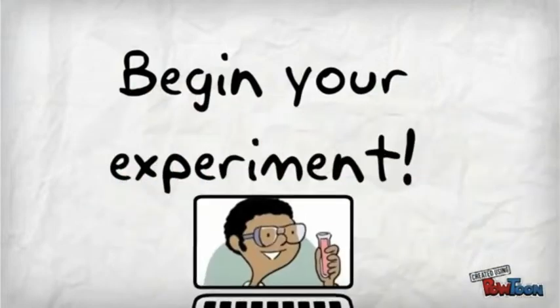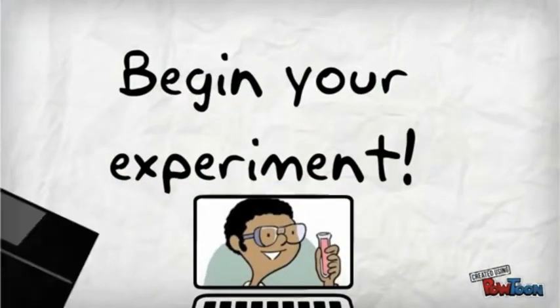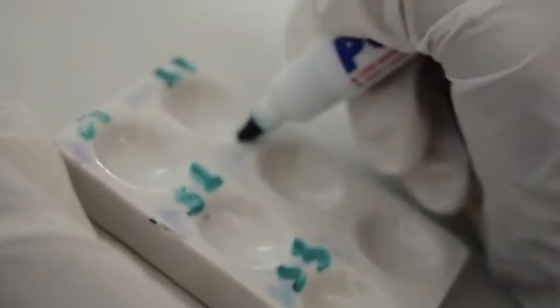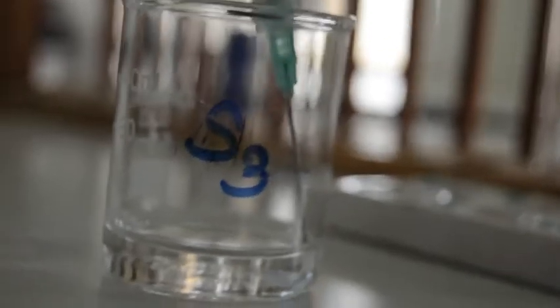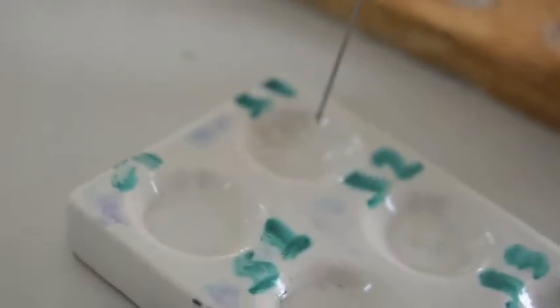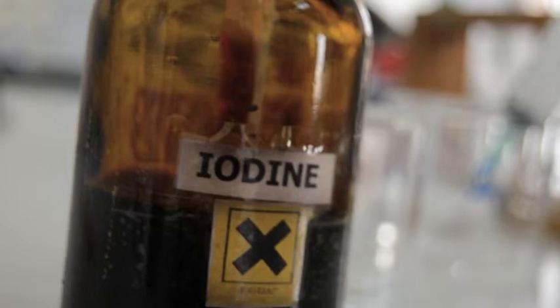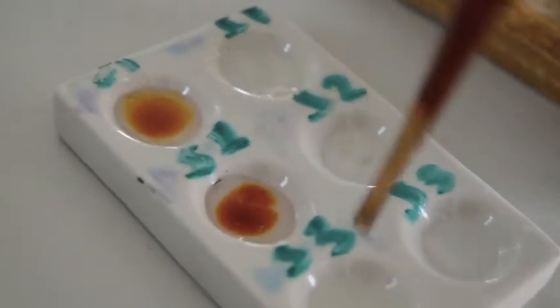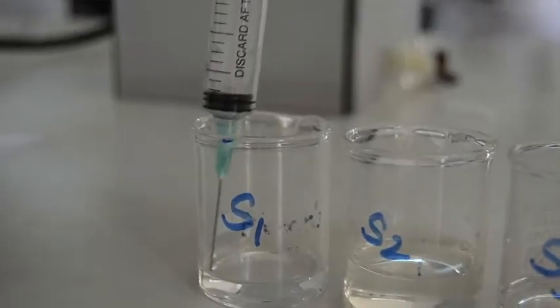Now that you're all set and ready to go, we can begin the experiment. First off, we're testing each solution sample for the presence of starch using the iodine solution. So we take equal volumes of each sample solution and put it on the tile where we're carrying out the experiment. We then add a few drops of iodine to each sample, knowing that if starch is actually present the sample would turn dark blue. None of our samples turned dark blue and hence there is no starch present.